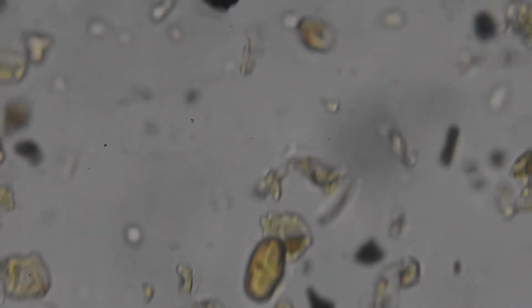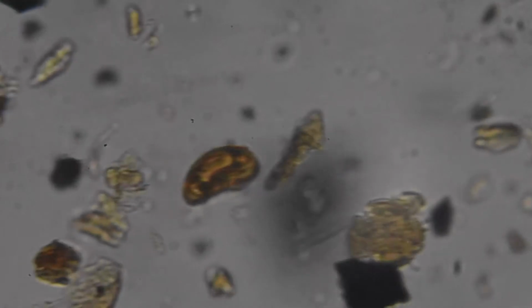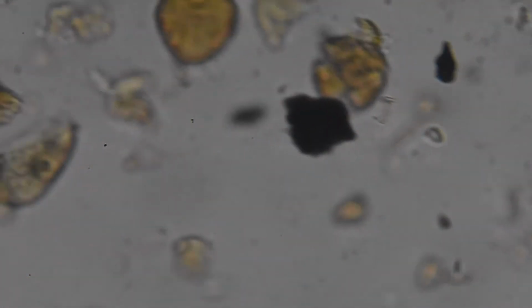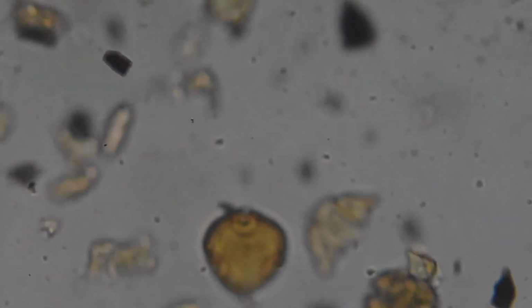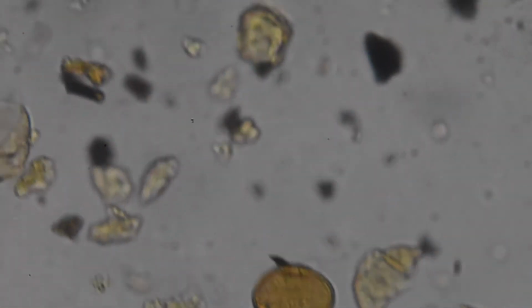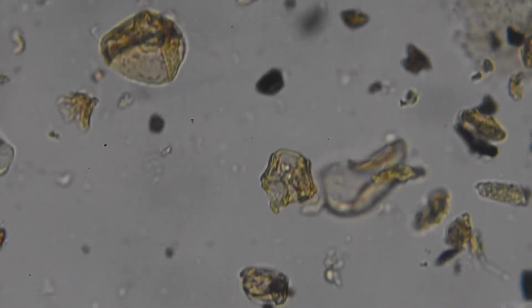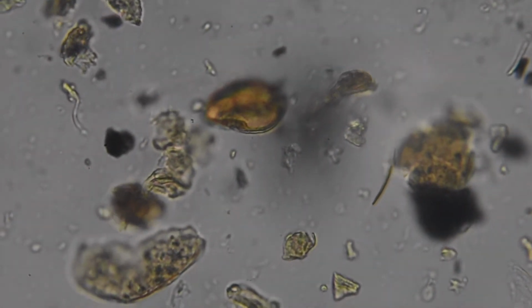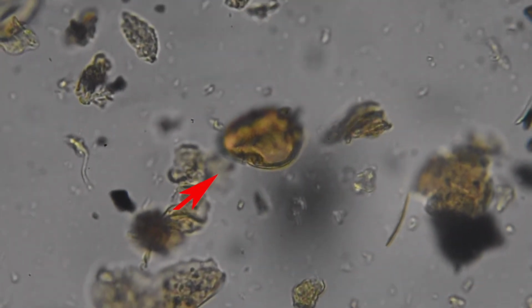Just now we had a really nice, here we go, let's see if I can get him to come into focus for us. There, now what I'm looking at is, get him to stay still. That one there. Can you see it? It's moved again. Let's see if we can find another one that's still. It might actually just float back round for us if we're lucky. It's this one here that I'm trying to look at.